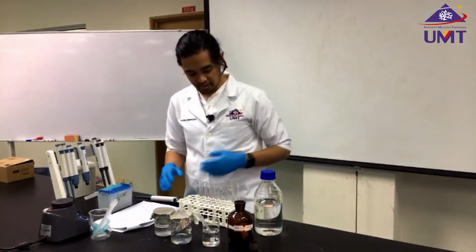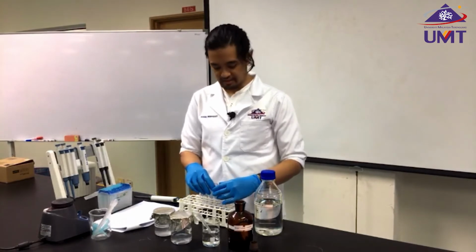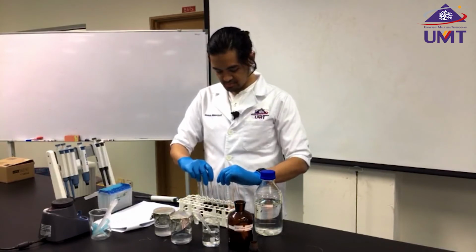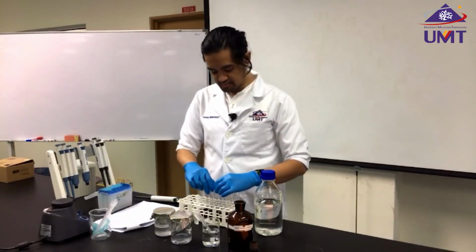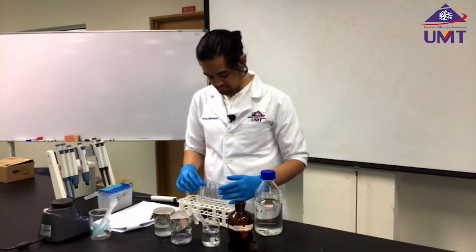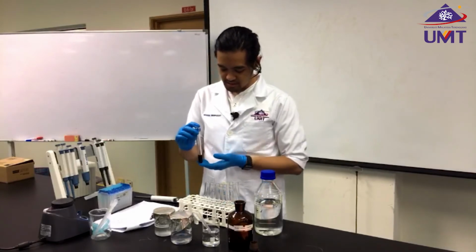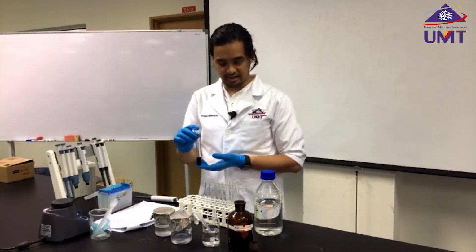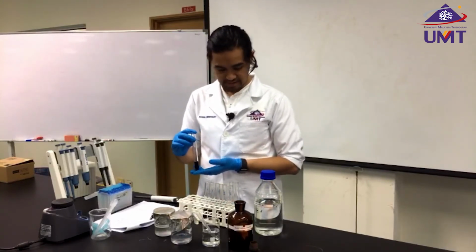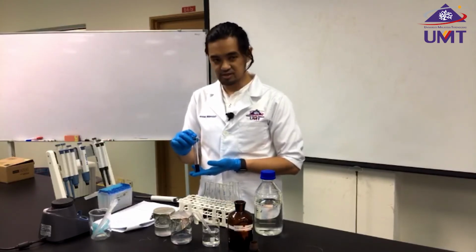And now we're going to determine our enzyme activity. So now we have our starch tubes with dye in them, and we already measured with the spectrophotometer for the standard curve plotting. And now we want to compare. We will use our sample, and we're going to add the enzyme into our sample and observe the changes in terms of colors and also in terms of the absorbance using the UV spectrophotometer.